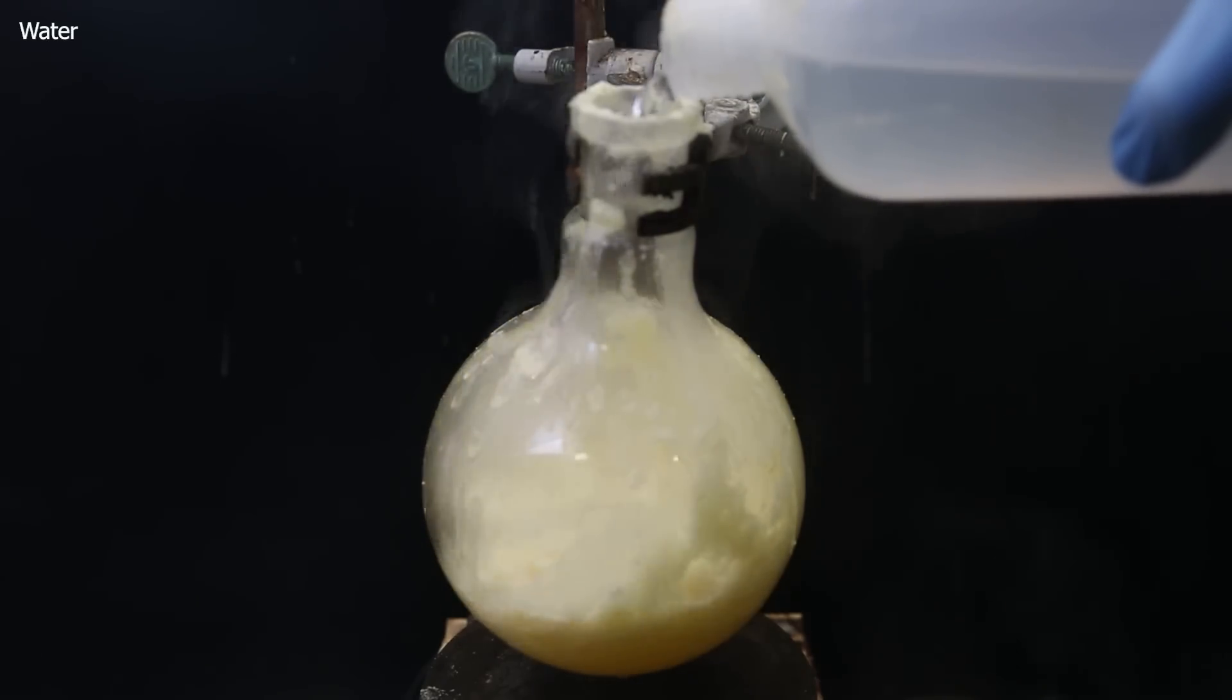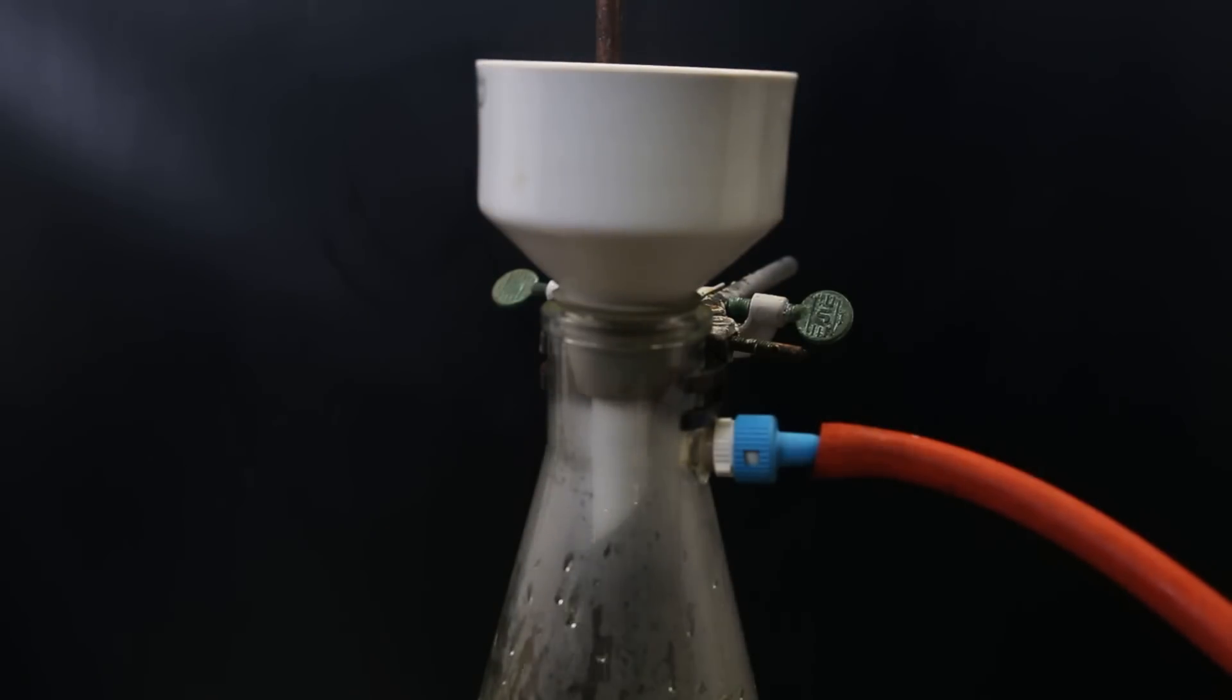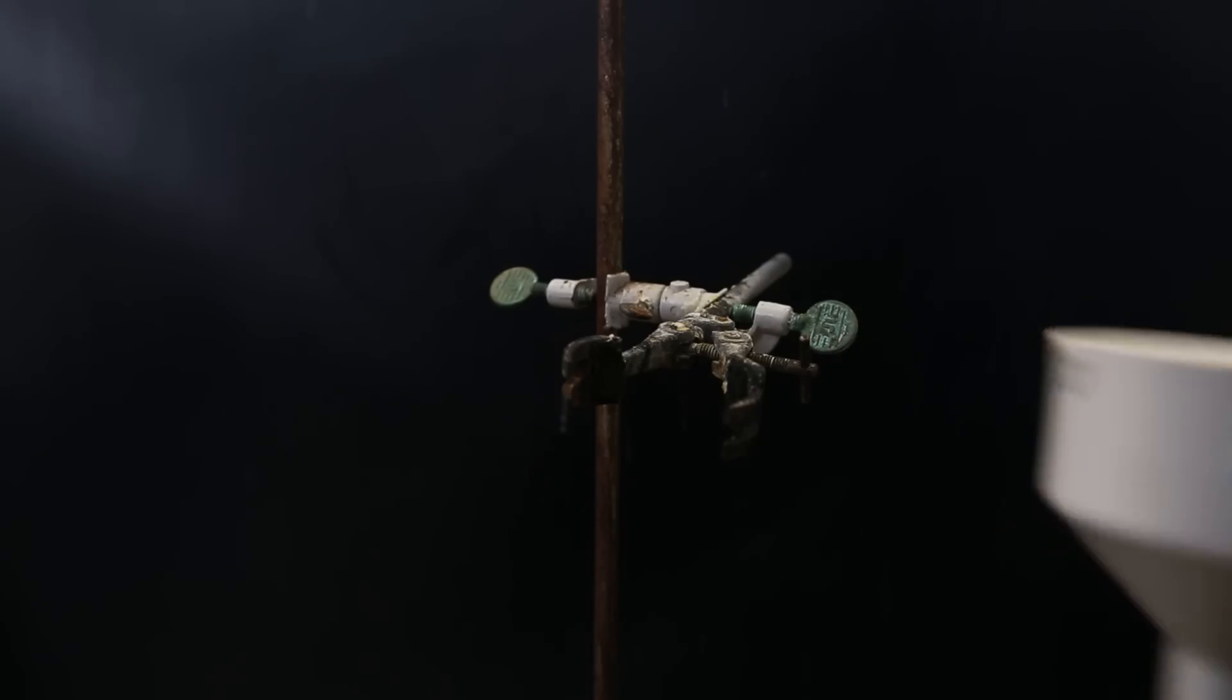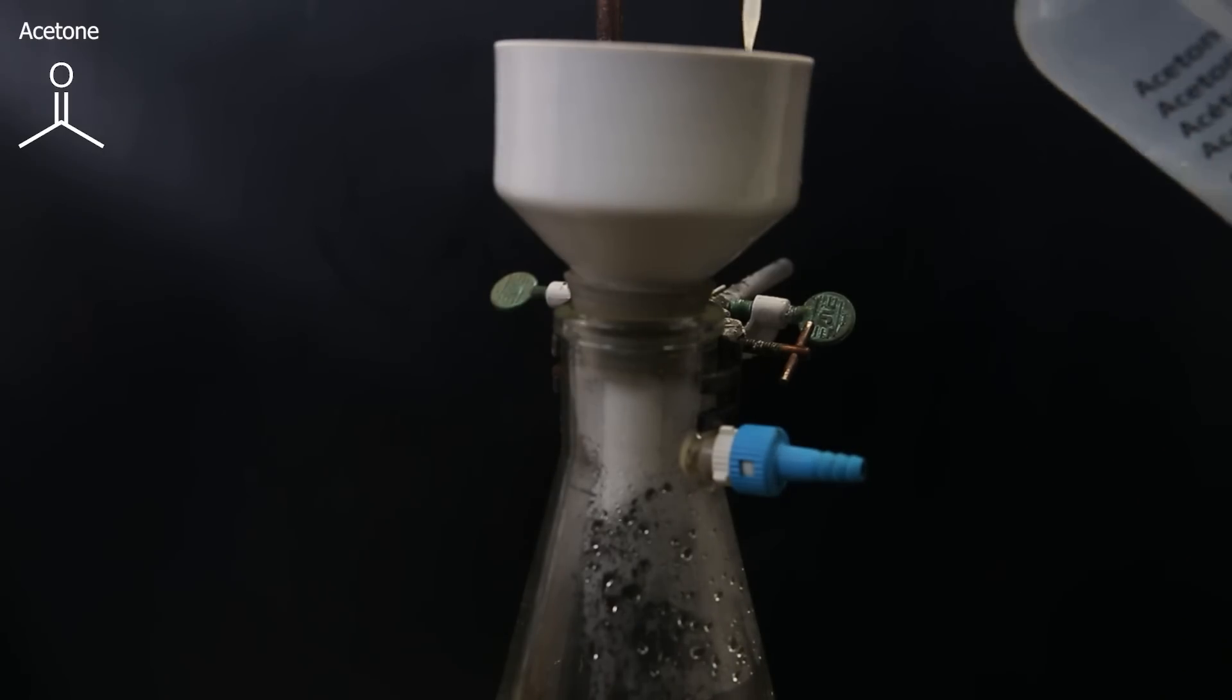Luckily, it wasn't too much of a disaster. After cleaning up what shot out, I filtered it all with vacuum filtration. The residue contains the product, so I emptied the flask and I dissolve all of the solids into acetone and let it filter through.